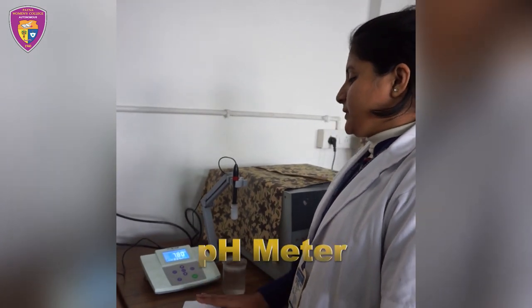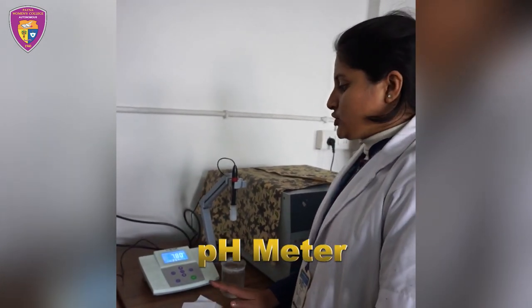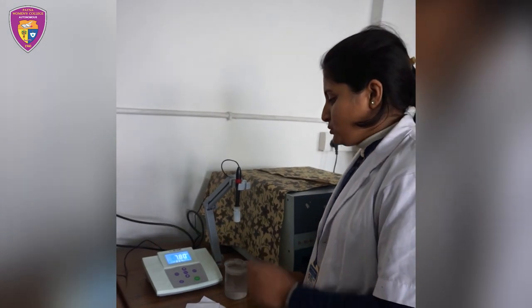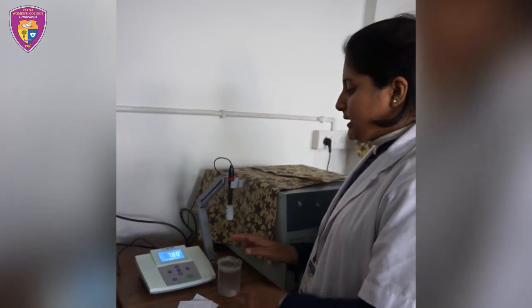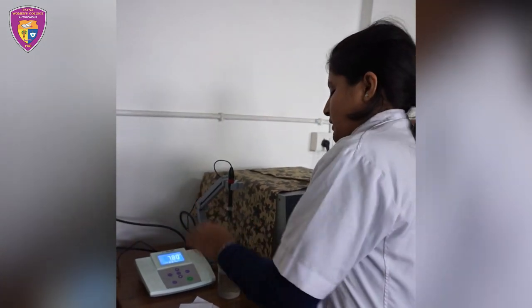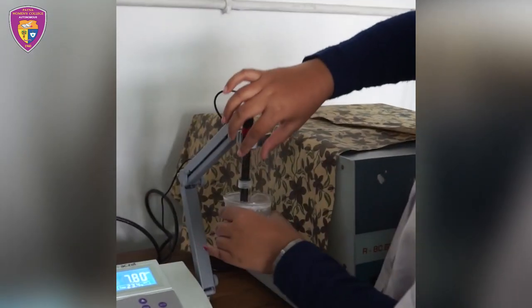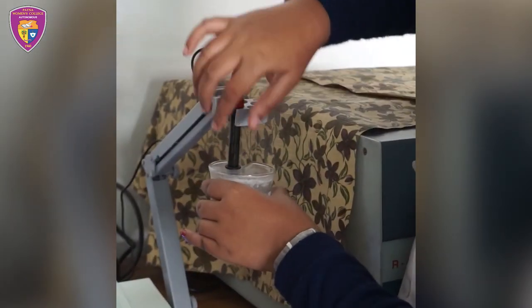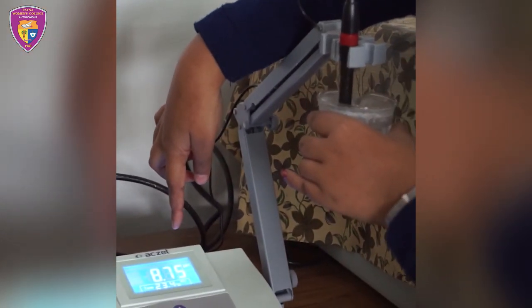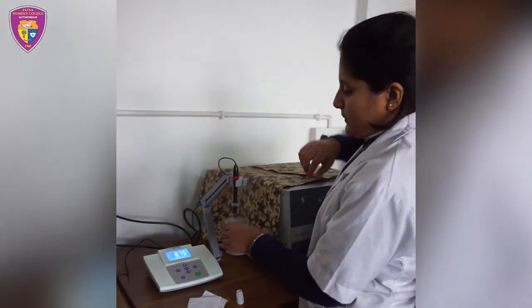This is a device called a pH meter. The full form of pH is potential of hydrogen. It is used to measure the acidity or alkalinity of a solution. The reading is shown here — the pH of this water solution shows 8.75.